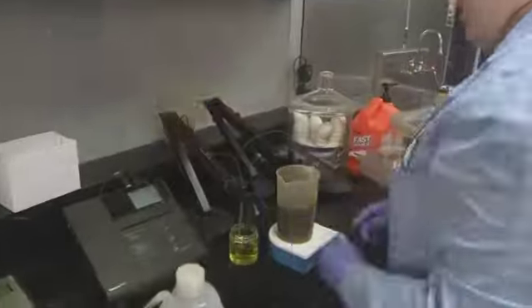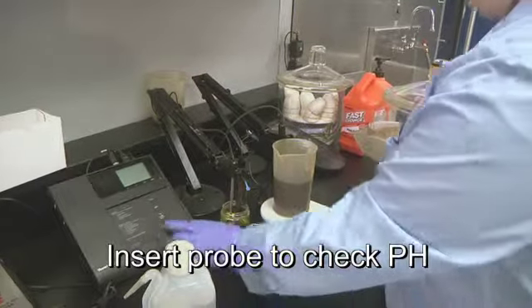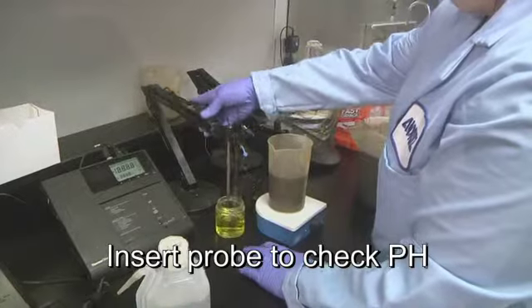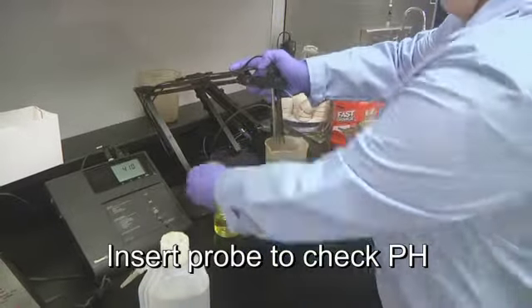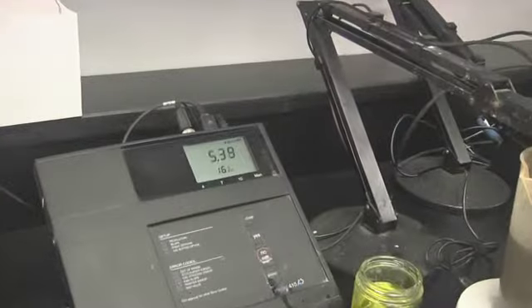The pH level is measured to determine the degree of acidity or alkalinity. The electrode is removed from the baseline buffer solution and immersed in the sample. The reading should be within 1/10 pH unit of the baseline buffer.